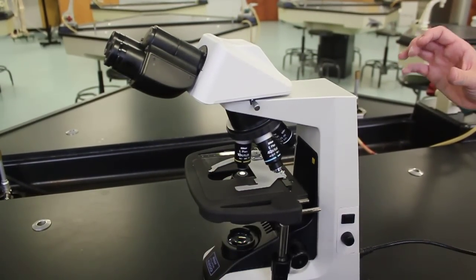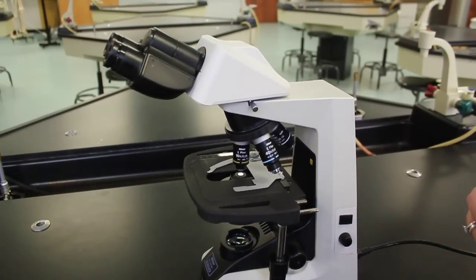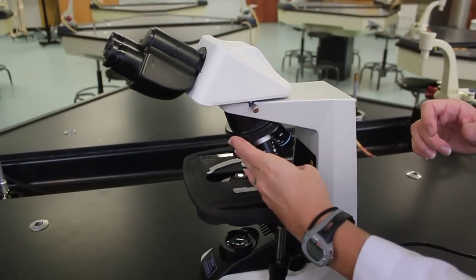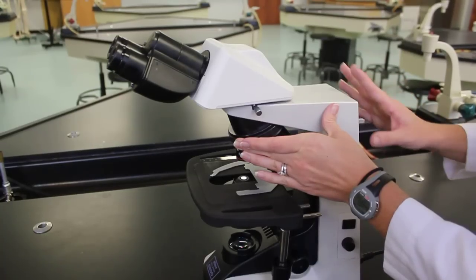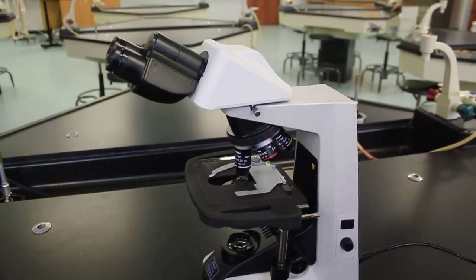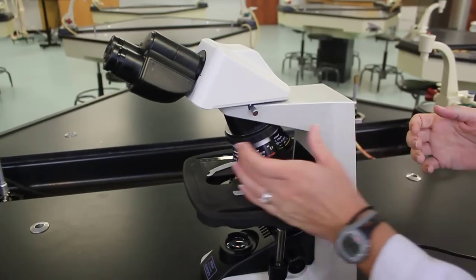Proper order is to go from 4 to 10 and then in the micro lab, switching back to the 4 and then the 100. You do not use the 40x objective in this lab.